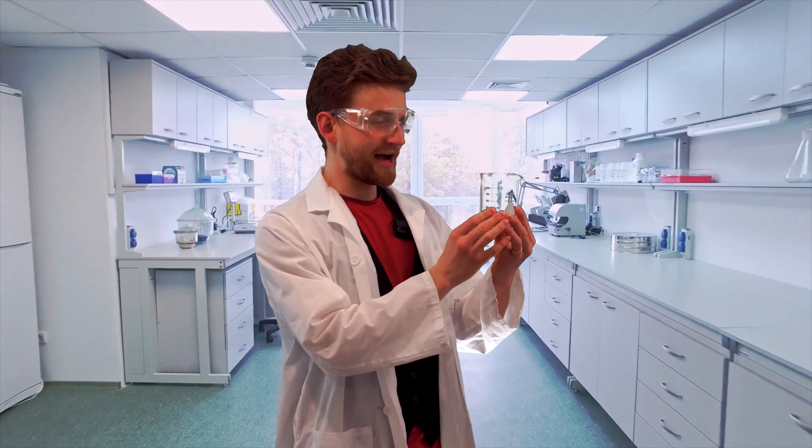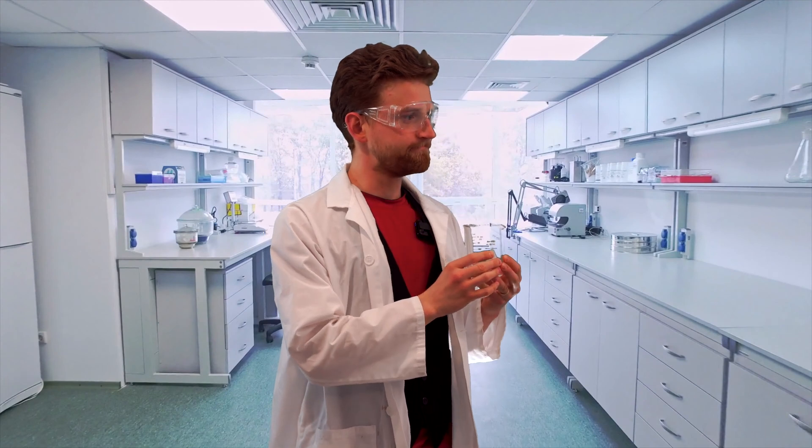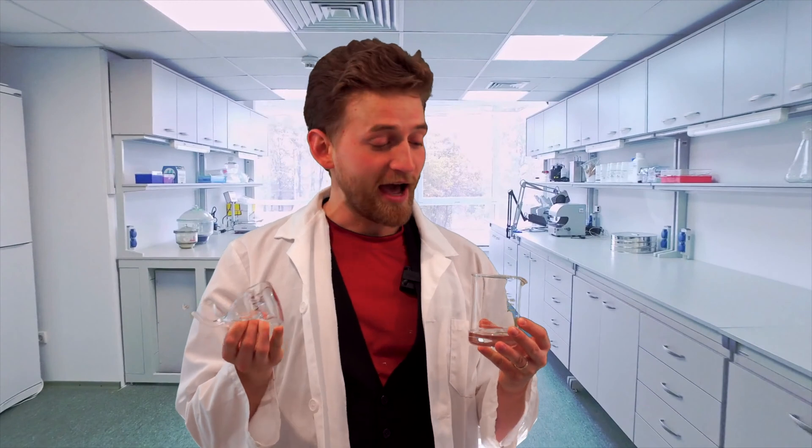Ooh, hydrochloric acid. How do I get some? Is it fun? Yes, it is. No — this is not hydrochloric acid. This is water. Having hydrochloric acid open inside of a studio with no windows and almost no ventilation is a bad idea. So don't do that.